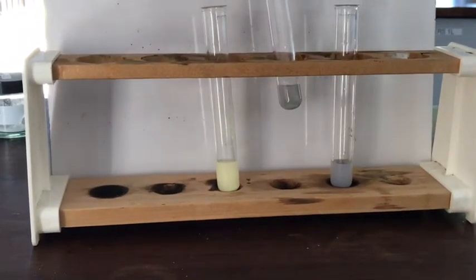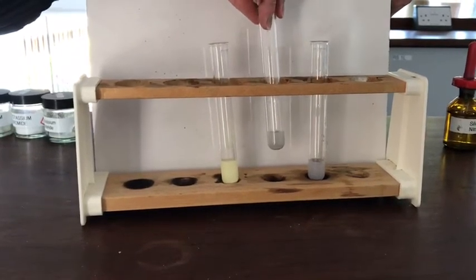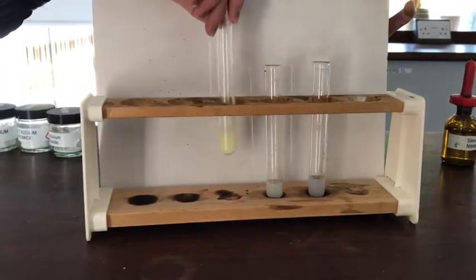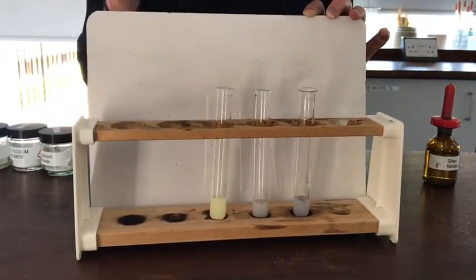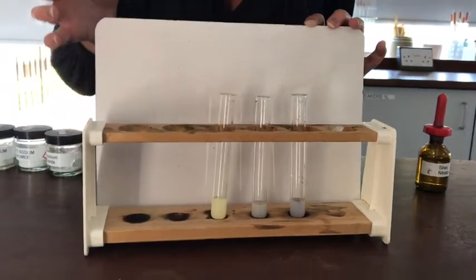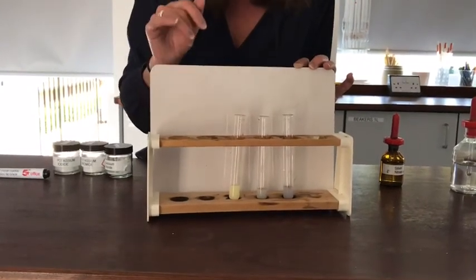I think these days we'd probably call it kind of greyish colour, sort of mixture between grey and beige. But this one is a cream precipitate that goes buff in the sunlight, don't we all? And this yellow one in the end hasn't really changed colour at all. Okay, so that's quite a handy way, if you've got some sunshine available, that's quite a handy way to discriminate between them because of this sort of final colour that they end up. But as I said, if you were to go on and study this at A-level, you learn a better chemical test to distinguish between them at this stage.